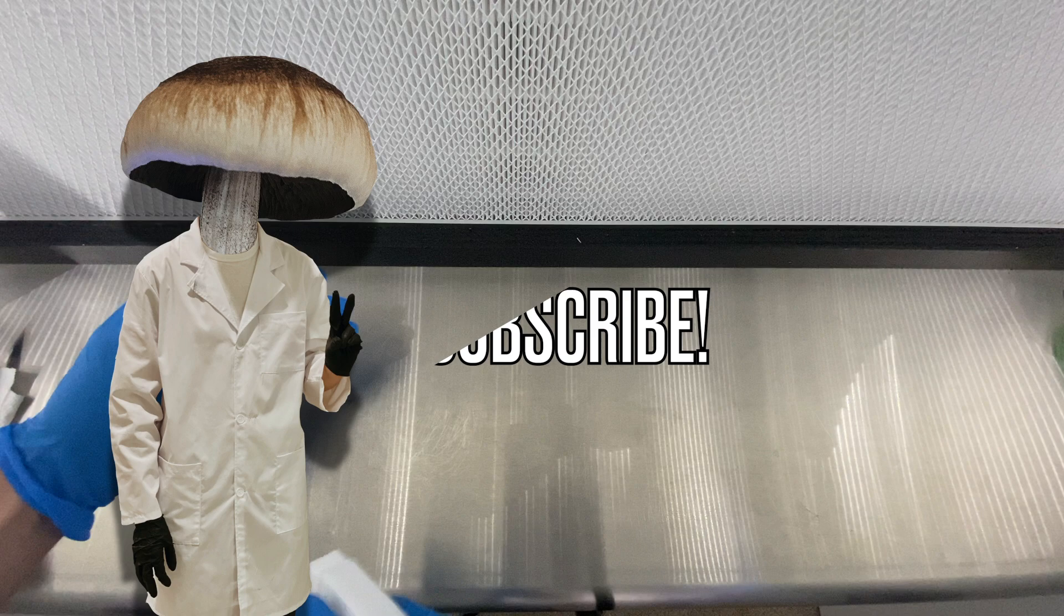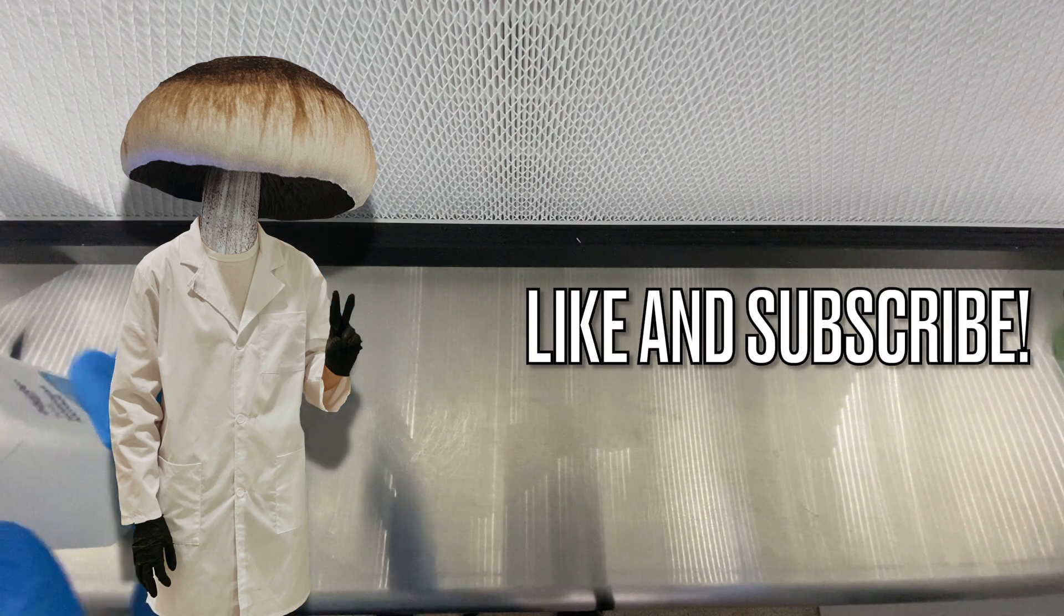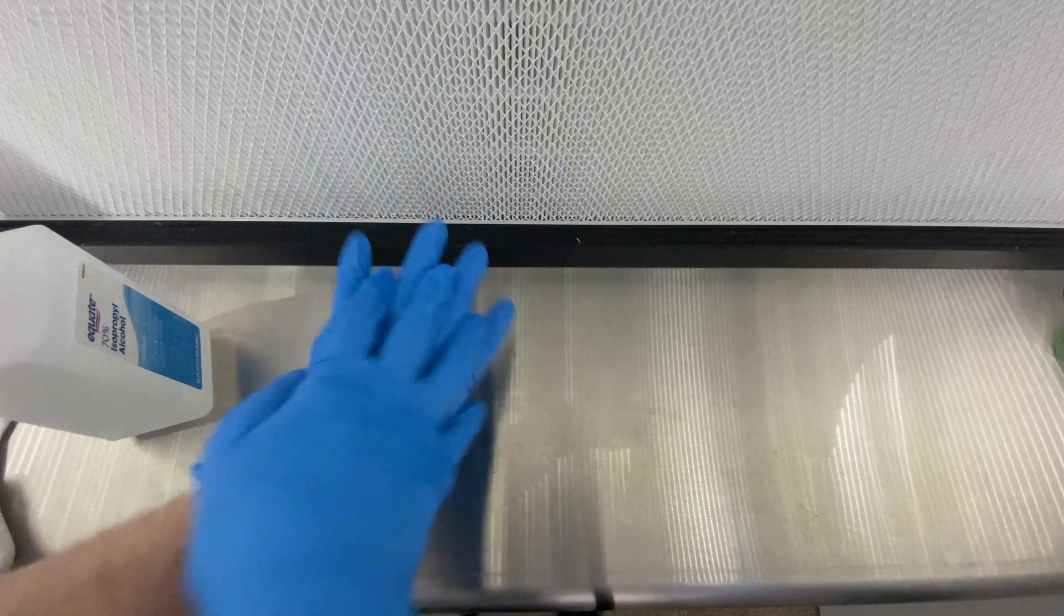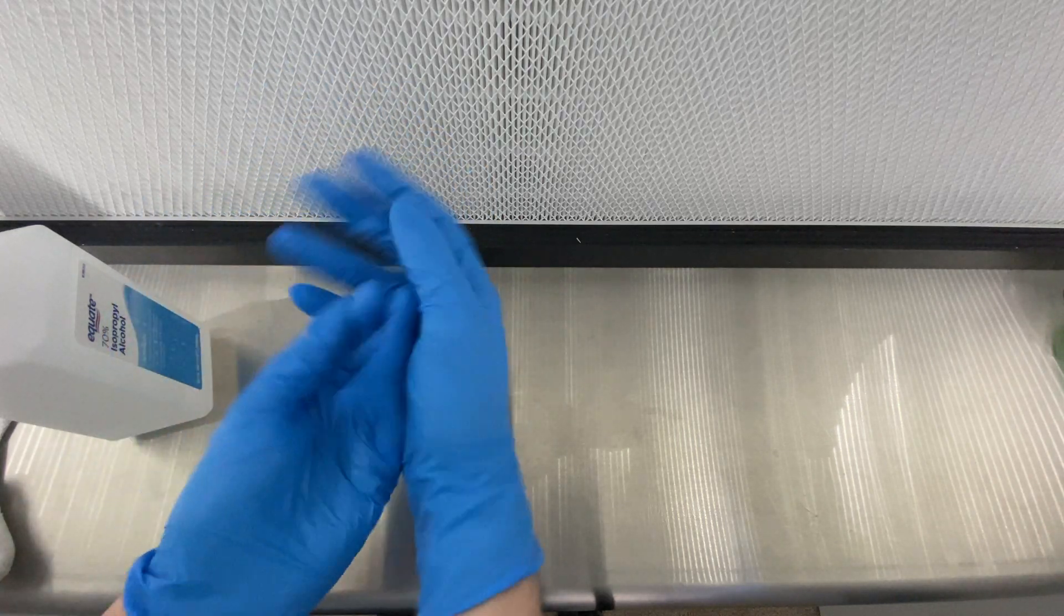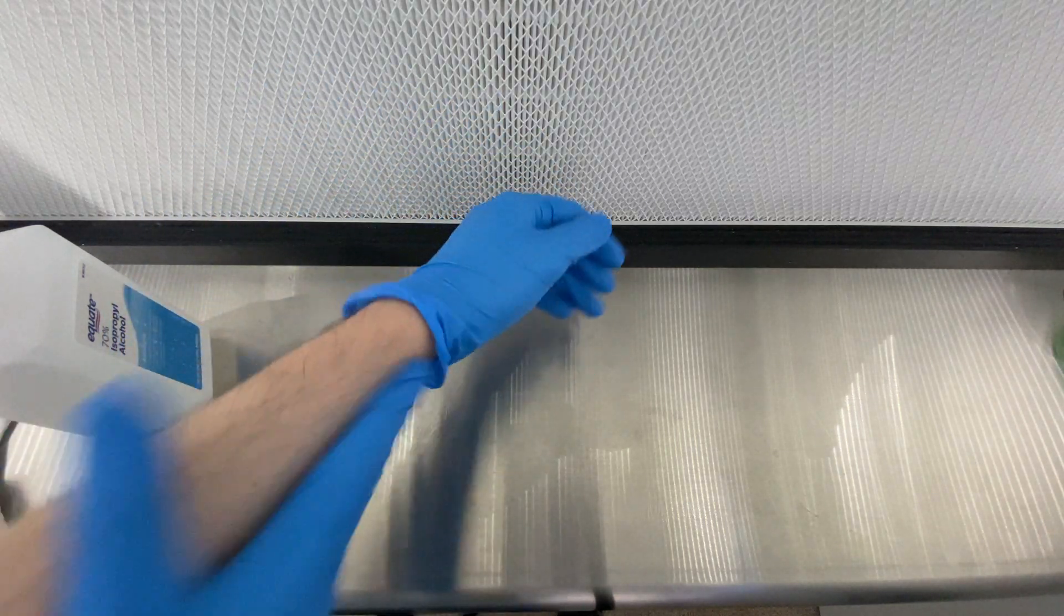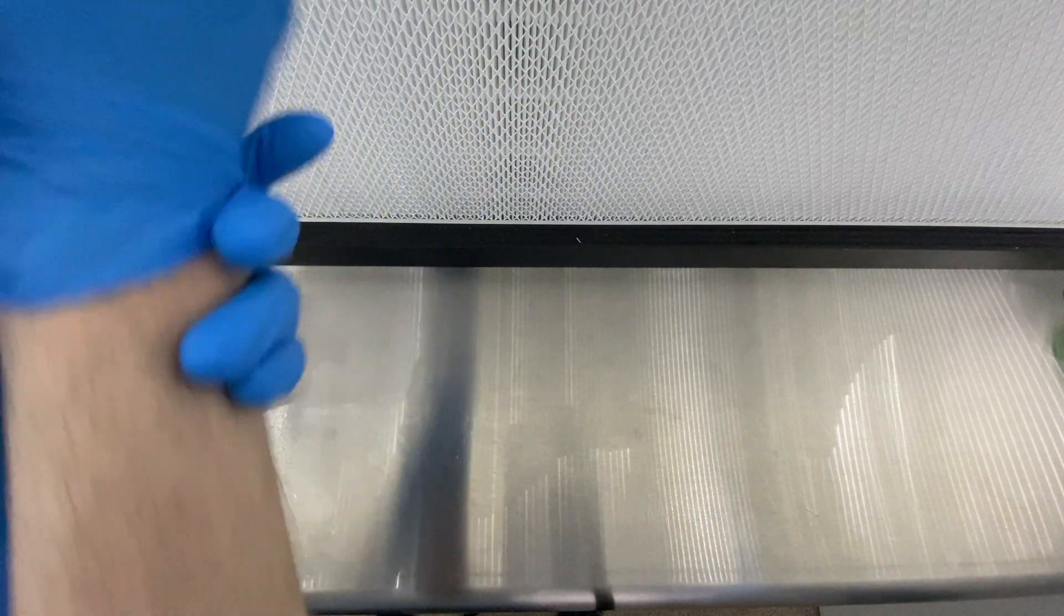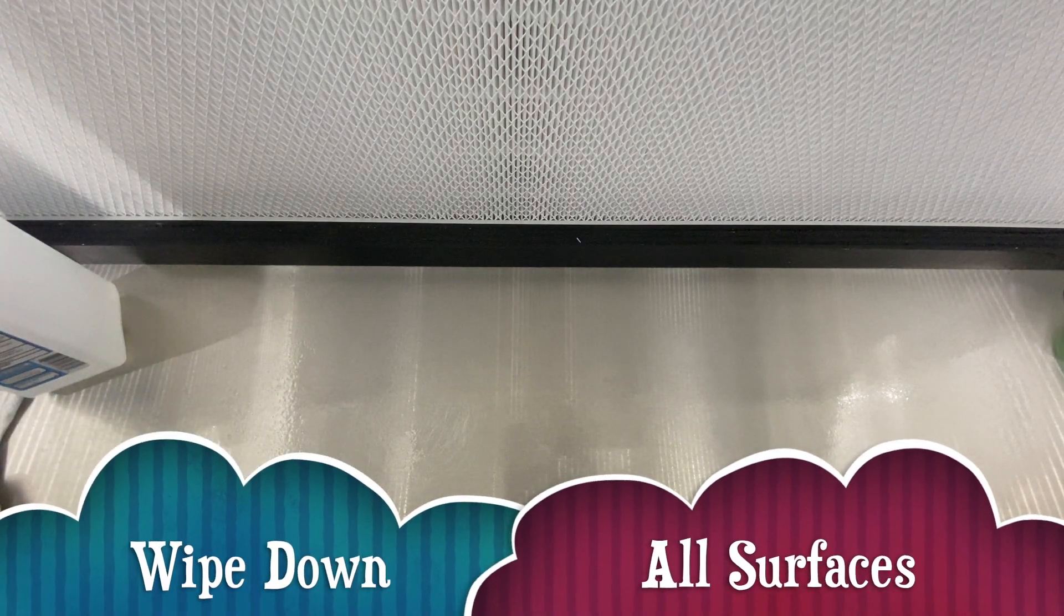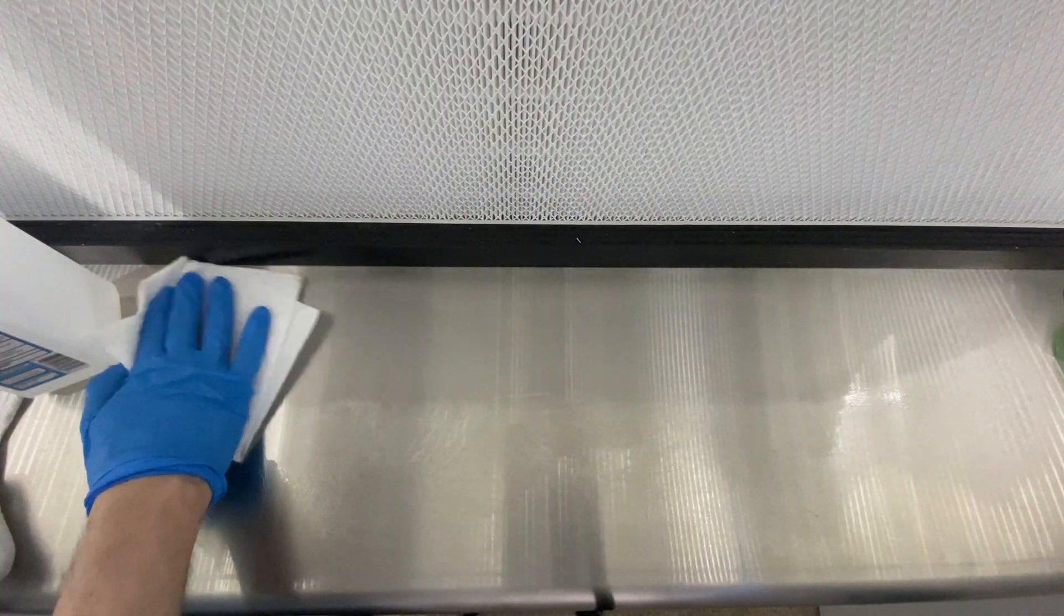Hello internet, thank you for coming back to watch another video with Fungi Mycology where we teach you all about how to grow any kind of mushroom, be it medicinal or gourmet. In this video we're going to be talking about how to take clones from plates, so transferring a culture from one colonized plate onto another plate so that you can continue the life cycle.